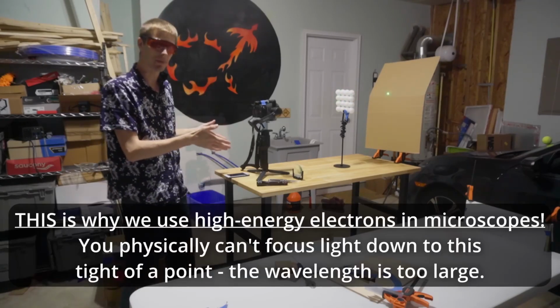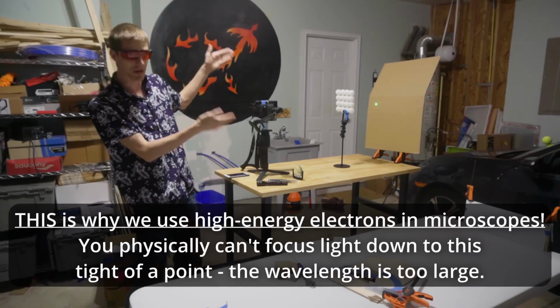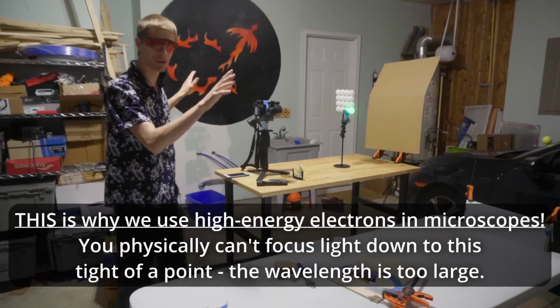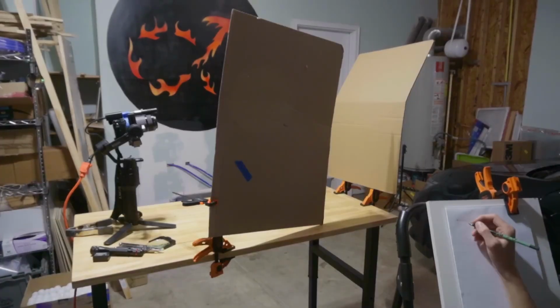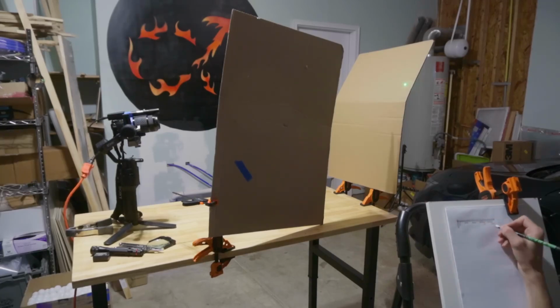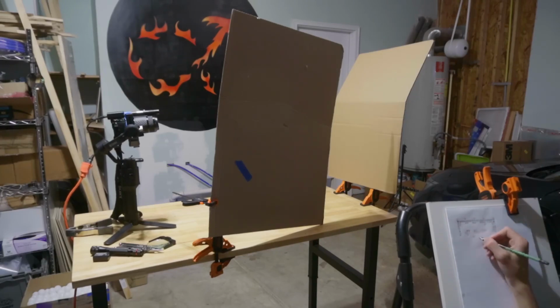So that's basically what's happening here, where the gimbal is guiding this laser back and forth, rastering across our field of ping pong ball atoms. Sometimes the laser hits an atom and causes light to scatter in all directions, and sometimes the laser doesn't hit an atom, goes straight through, and runs into the backplate. So now I'm playing the part of the microscope sensor. I know where the gimbal's pointed at all times, and I can tell whether or not the beam is going through because I can look for the green dot on the piece of cardboard, but I can't actually see the sample. In reality, this is because the sample is microscopic and therefore basically invisible.